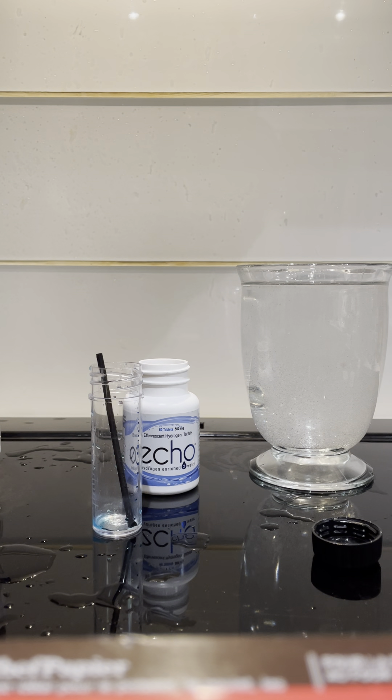I've got three drops. In the open cup, it's no better in a bottle — it just got somewhere between 0.3 and 0.5 parts per million. Neither of these tests would qualify it for the minimum observed therapeutic concentration by the IHSA. And again, these are years past expiring.